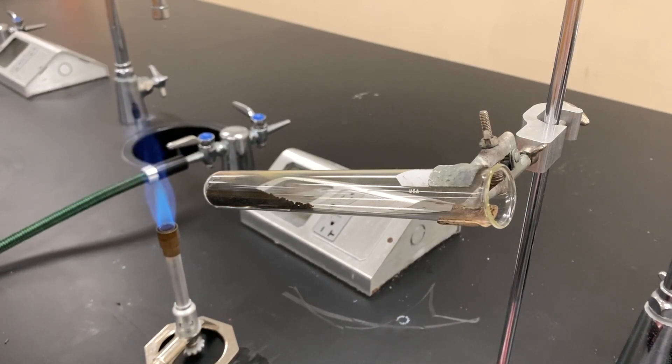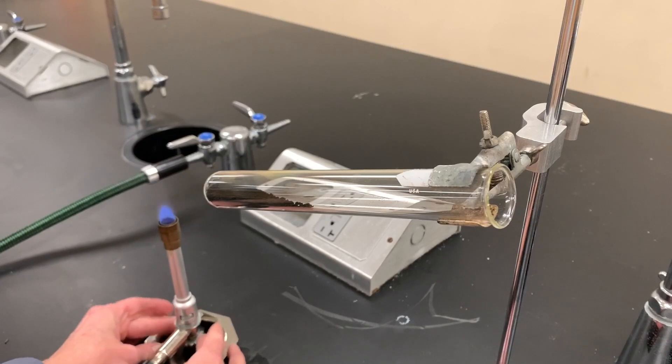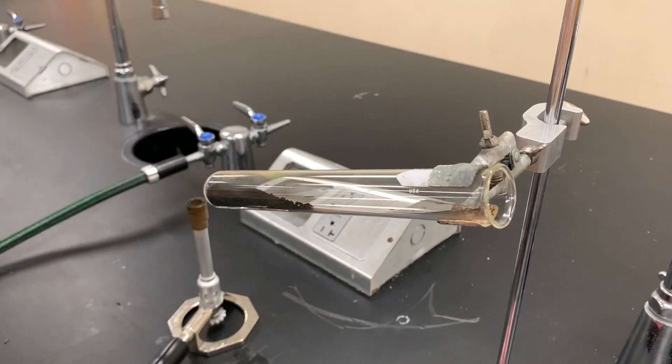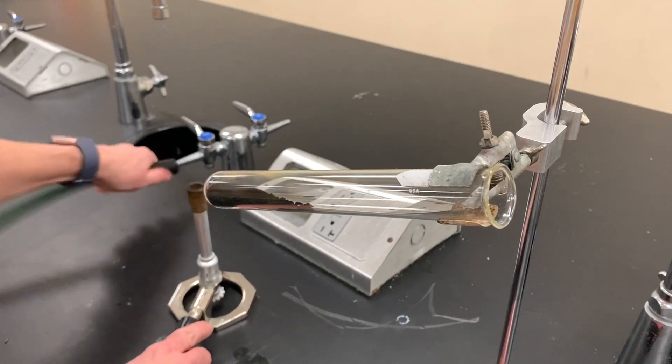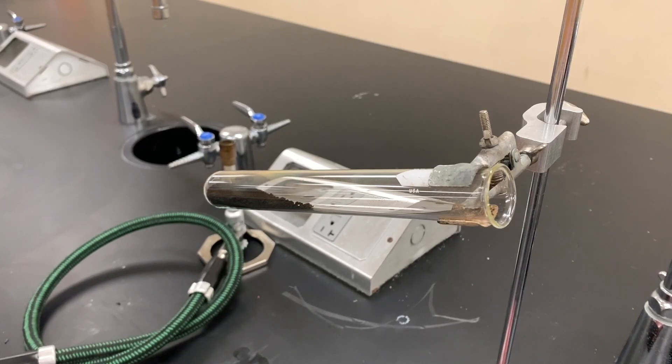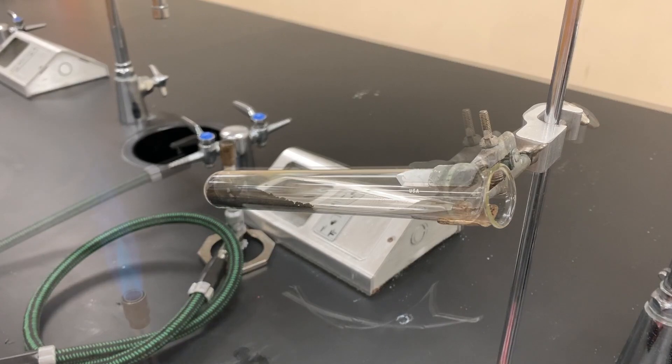Usually you turn it off from the bottom and lower it, then make sure you put the gas jet back to perpendicular. Remove that whole setup. I like to have my students pretzel it like that and then let this sit for about three to five minutes before we weigh it.